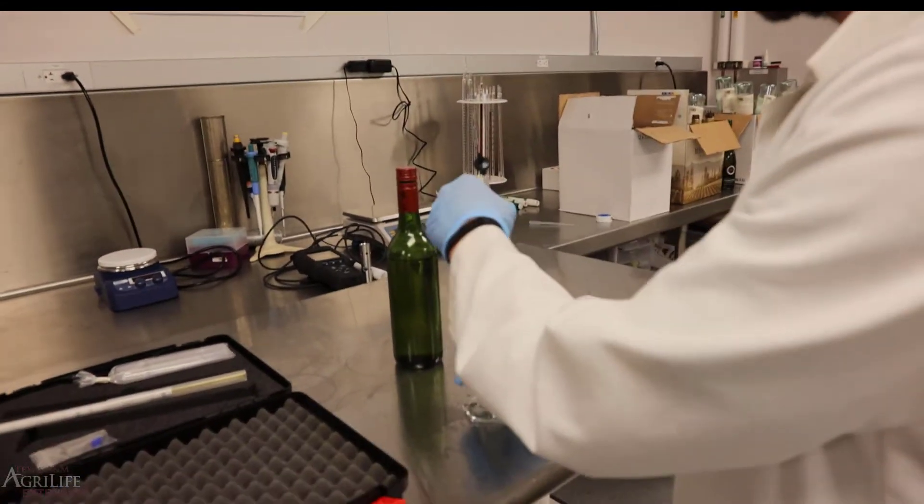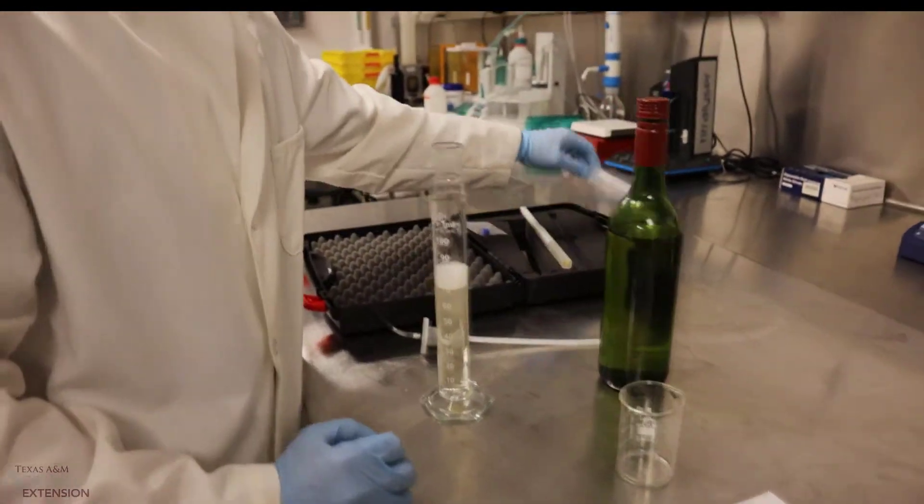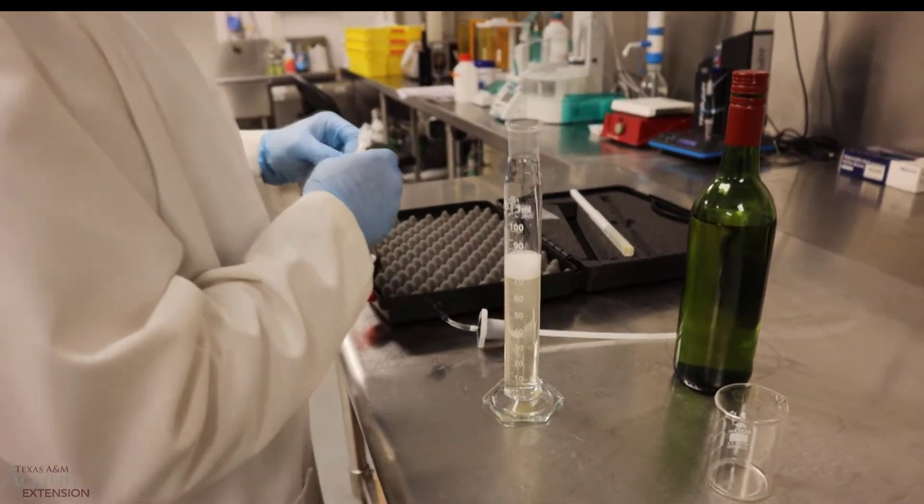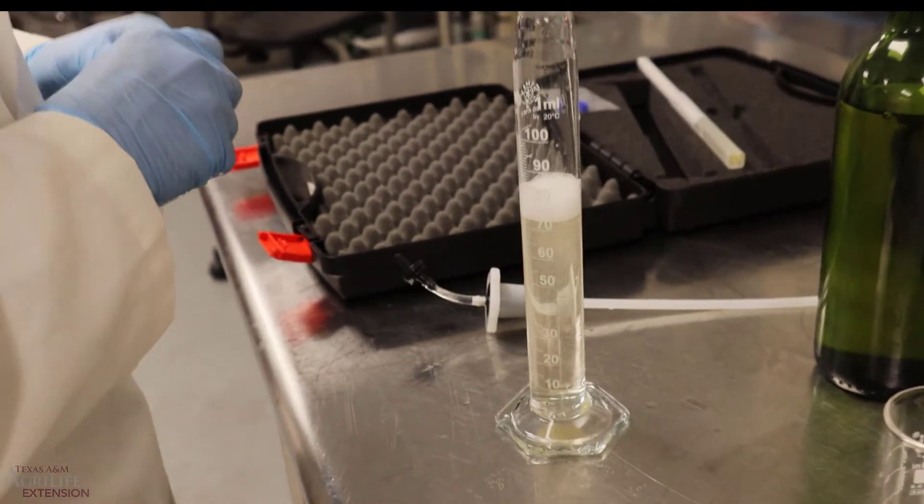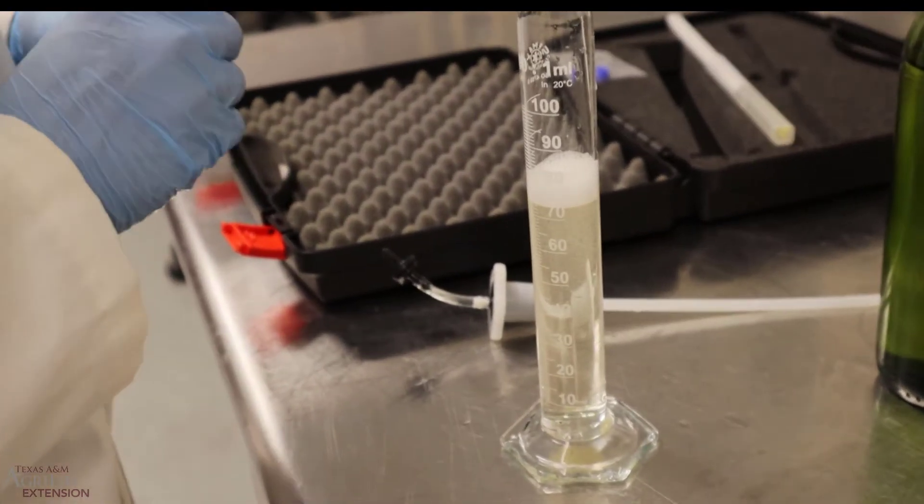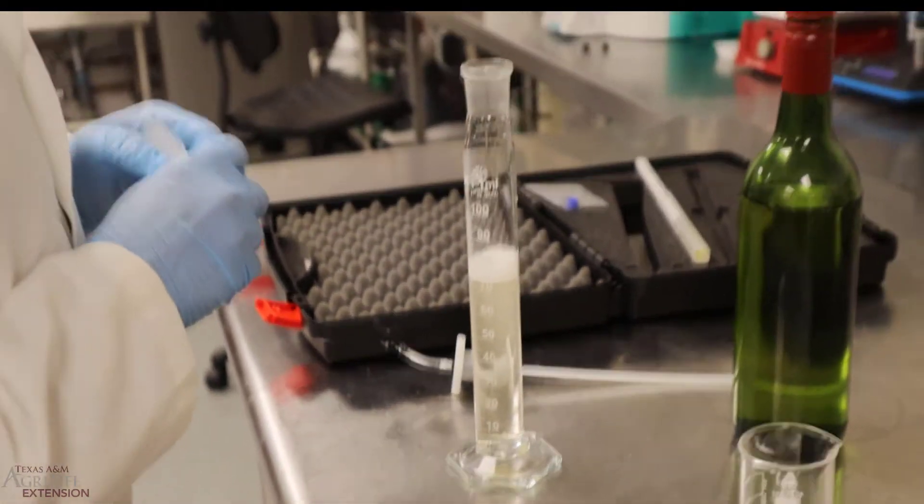So when doing this, we'll have a little foam in there. A couple of tricks to get the foam out. You can use a pipette or you can use a little bit of ethanol as well.